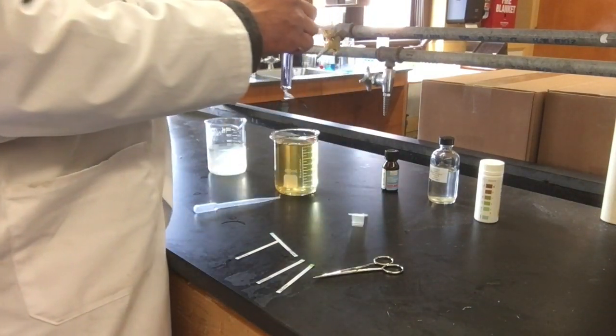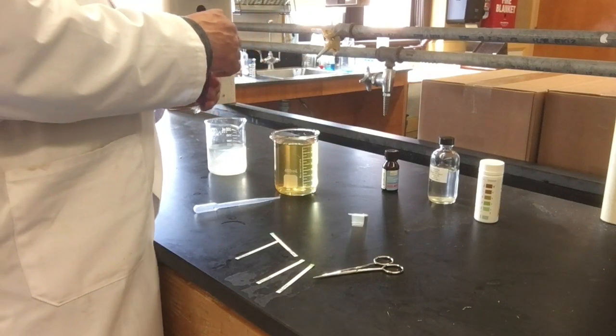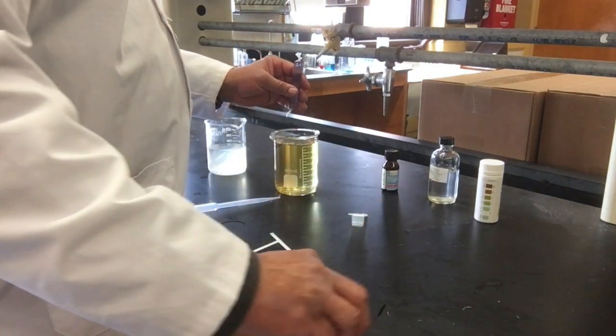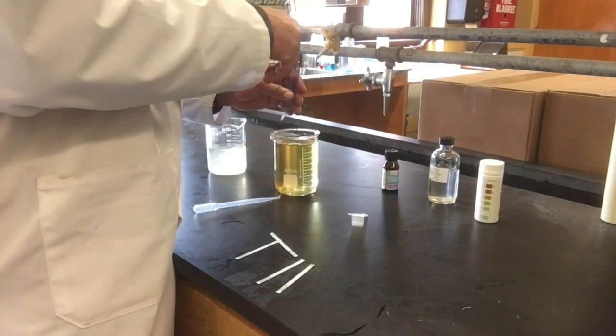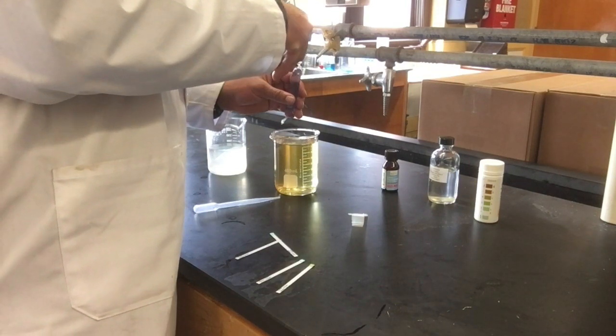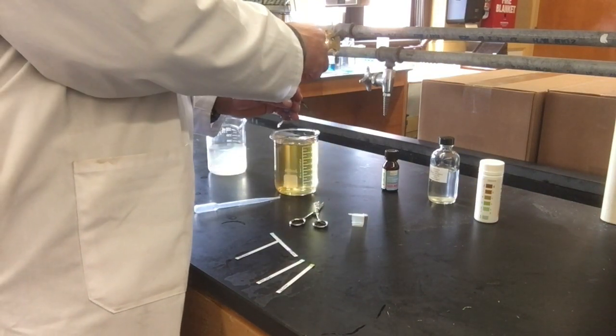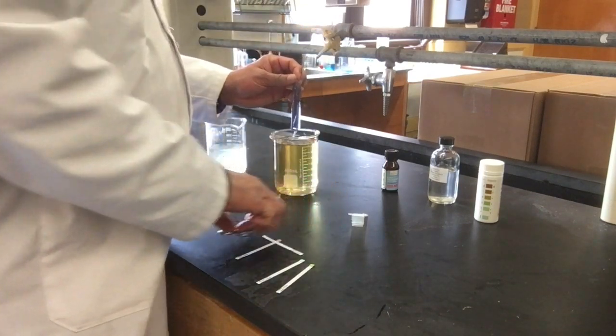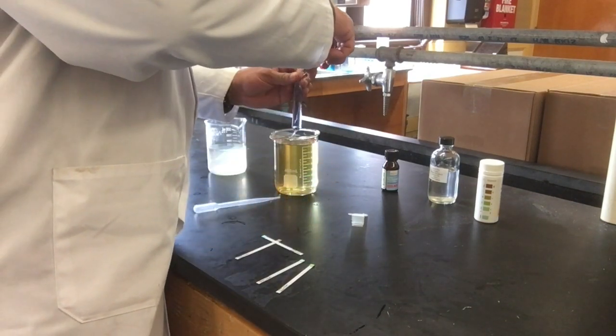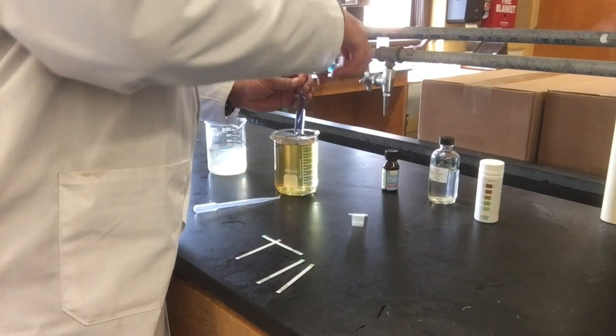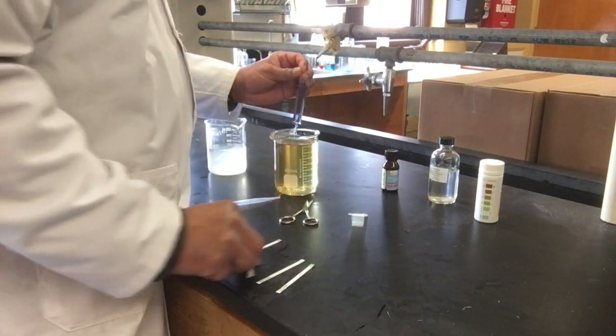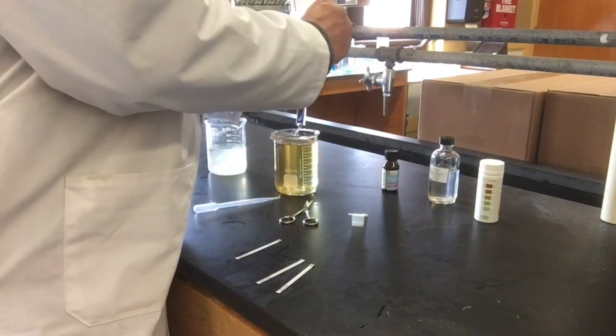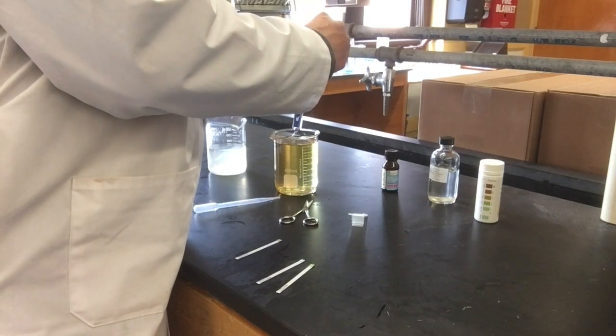I want to double-check the glucose. I know no glucose came out. I'll hold this over the beaker and cut the bag carefully. Before it breaks, let me test the bag's contents.